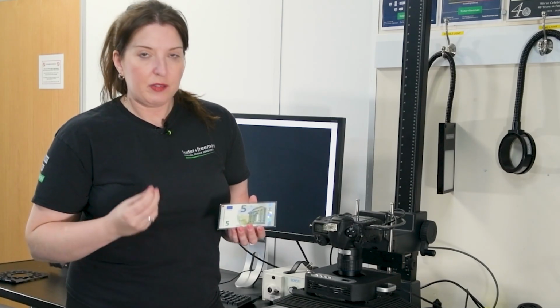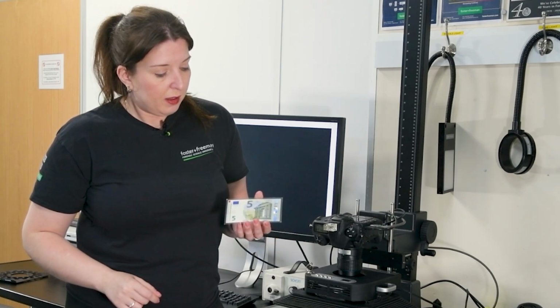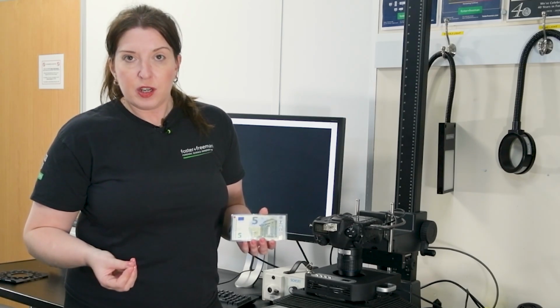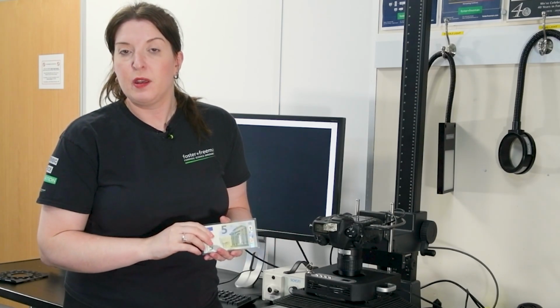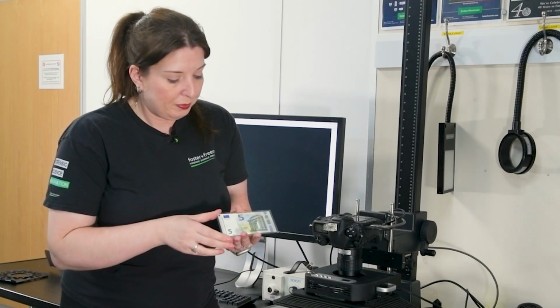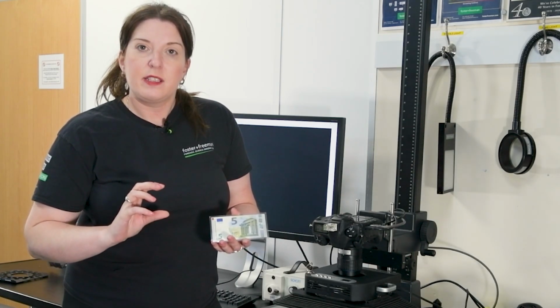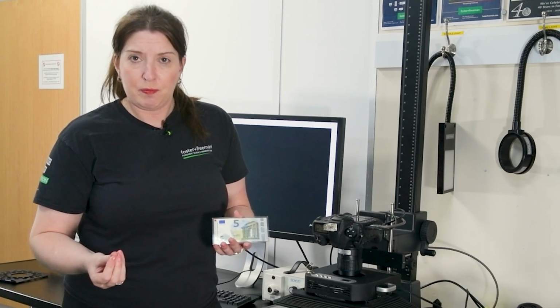Now, quite often we have security features in banknotes which are to our advantage when photographing finger marks. Pretty much every banknote on the planet will have some form of infrared security feature where parts or huge parts on both sides of the banknote could drop out under the infrared. When you hear myself or Calypso talking about something dropping out, what we mean is it disappears or it fades and becomes less visible. Now, the way that we can then employ this on DCS is we can use infrared light to drop out these backgrounds to make the fingerprint more visible.